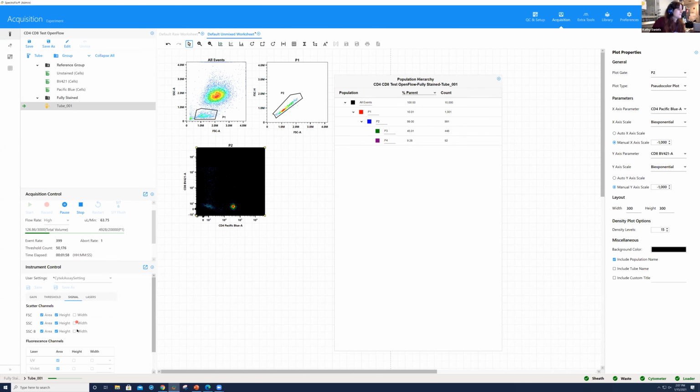So I didn't set it up today. I was trying to save some time. I didn't go through exactly everything, but we did do that in the first session where we enabled width. But by default, forward scatter area and height, side scatter area and height, and side scatter blue area and height are always selected. But that is a good additional parameter to have open for singlet detection, always. And obviously we're just doing two colors here.